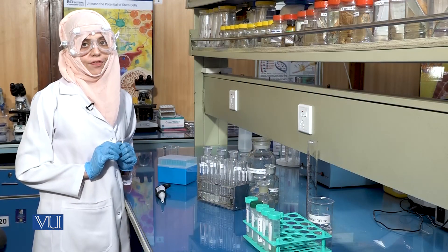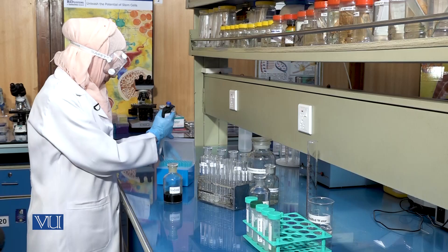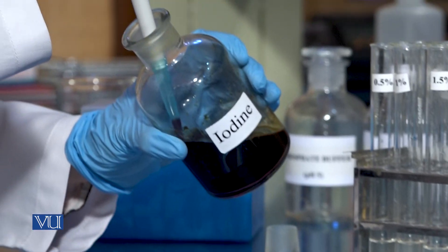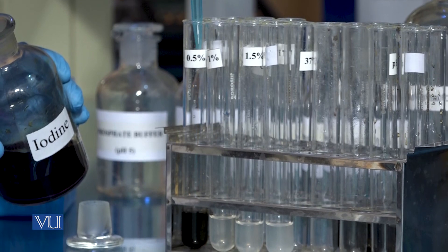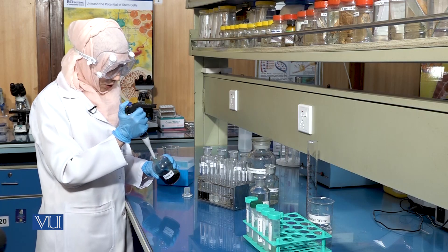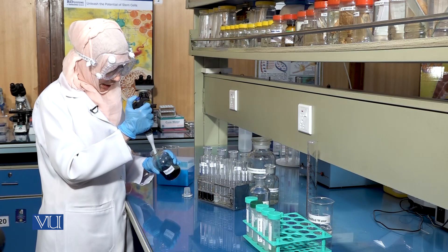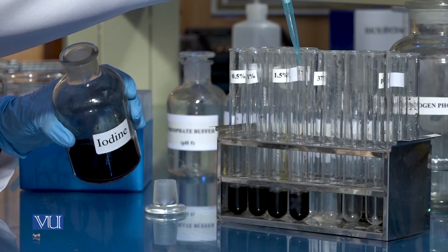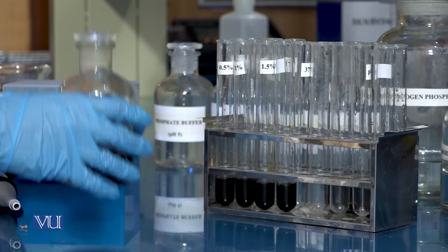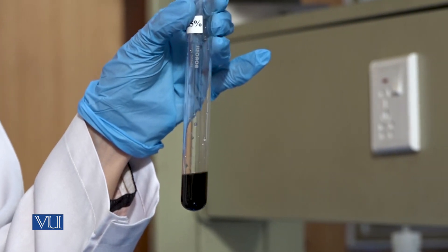We will then add 0.5 ml or 500 microliters of iodine solution to each test tube. Iodine will react with any residual starch present in the sample to give a blue-black color. The intensity of this blue-black color will give us an idea about the amount of starch still present in the sample and hence the activity of amylase.